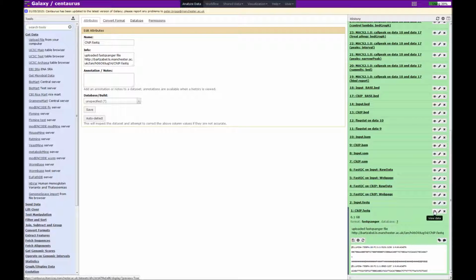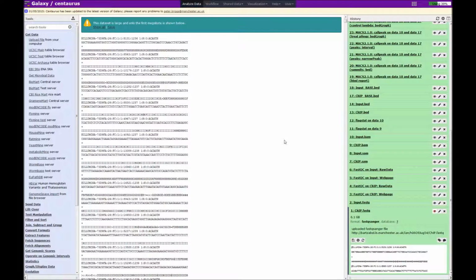So if we go ahead and click on that View Data Eye, in just a few moments that will appear in the middle. So here we have a fastQ file. The top line is the name of the read and the barcode here. Then we have the actual sequence, and then each of these corresponds to the quality for each base in the sequence. In this example, the reads are single-ended reads that are 68 bases long, although this is a bit unusual, as typically I'm dealing with paired end data that are 101 bases long.